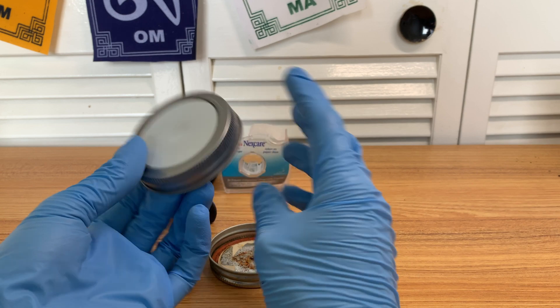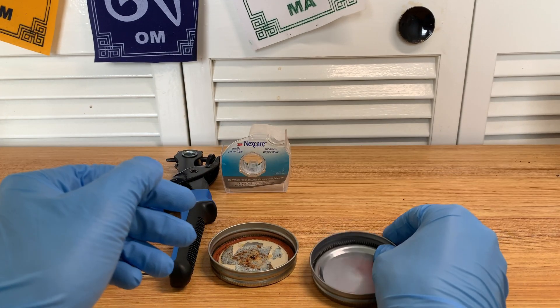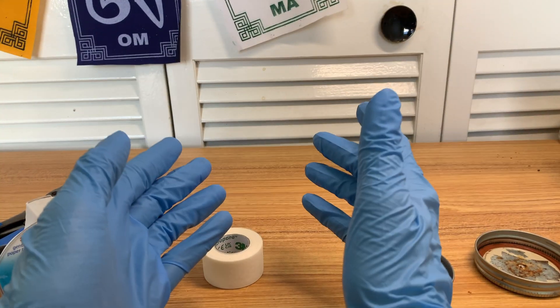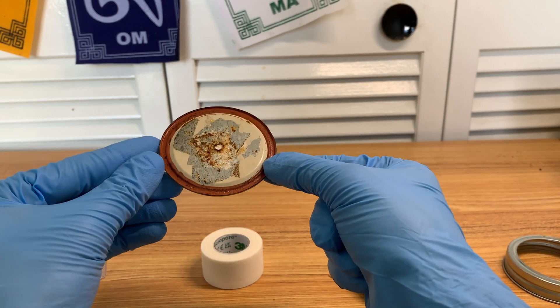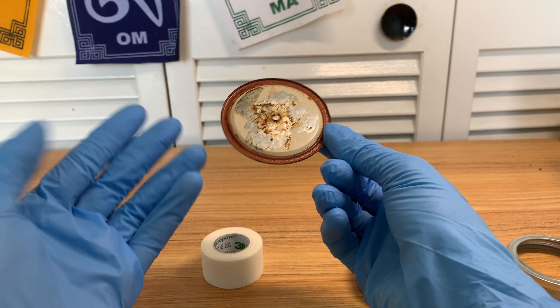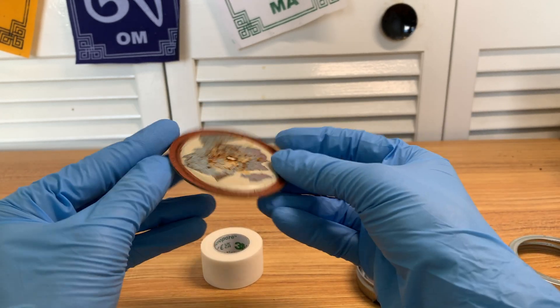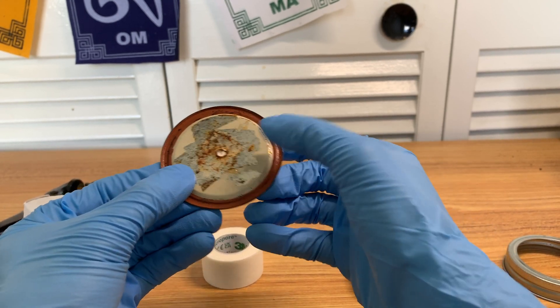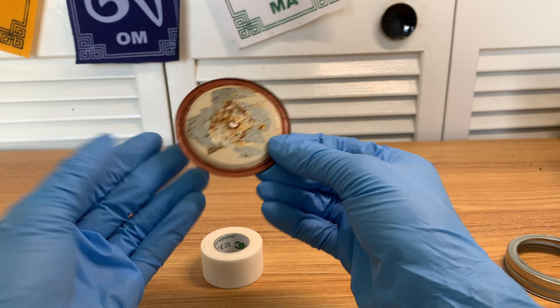This is the method I've been using for a year and a half now and it hasn't let me down. But there are some downsides to it, and some convenient parts to using one with micropore tape. Also, I forgot to mention about rust — I know a lot of people have the idea that rusted grain jar lids can't be used. That's nonsense. Once you sterilize it, it's completely fine, same with metal. It's just a cosmetic thing. As long as the structural integrity is still fine and the rust isn't taking off huge chunks out of your jar lid, you're completely fine.